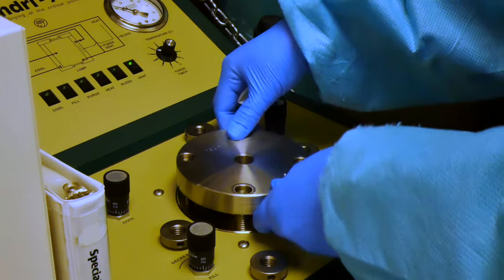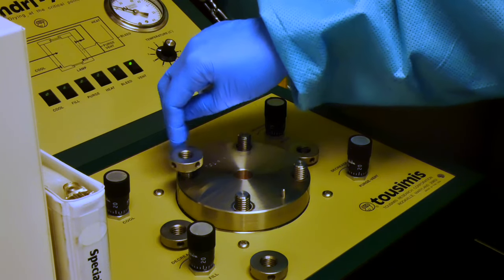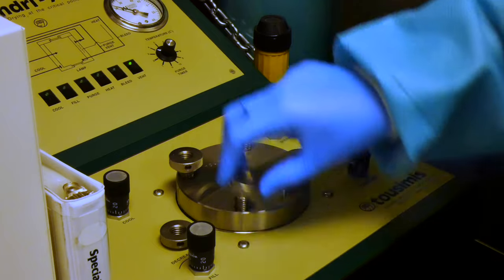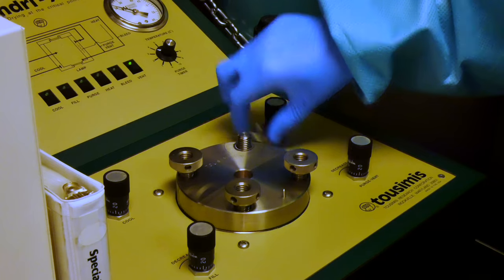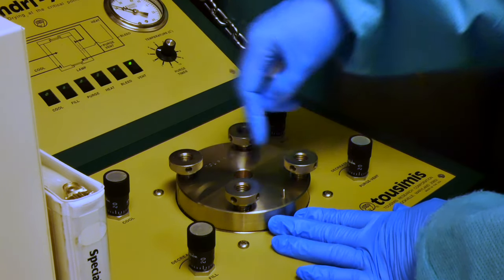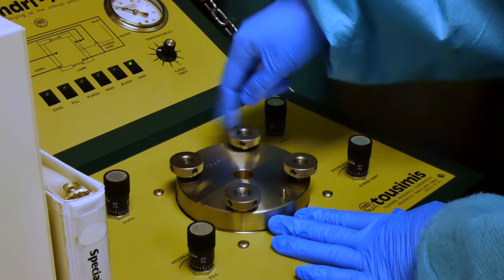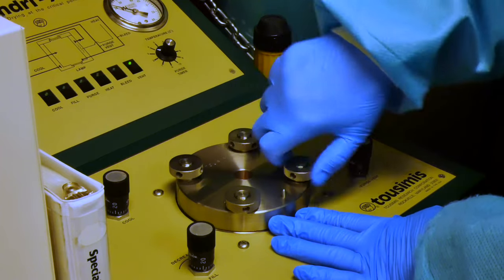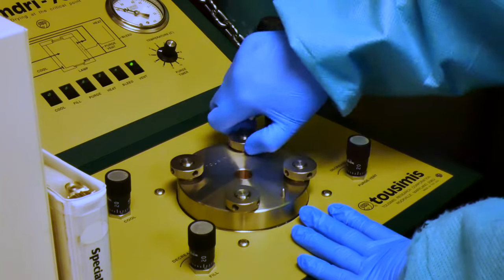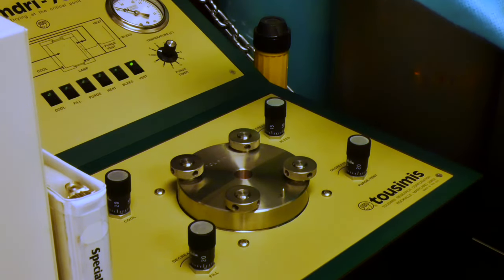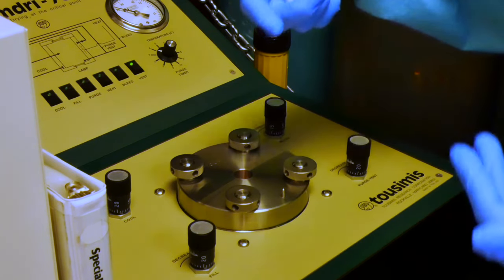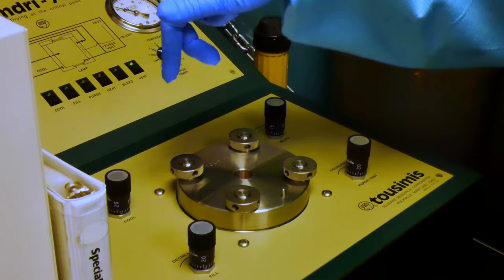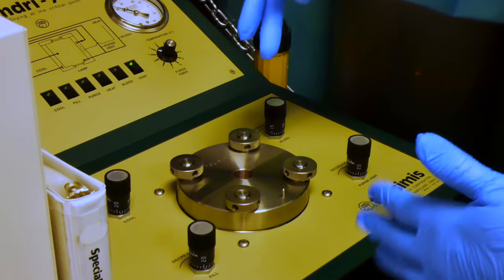And we'll secure the lid. And we'll use a diagonal method to tighten the bolts. As you're tightening down, right now it feels like nothing is continuing to move too much. And you do when you're removing the bolts, it's also important to do it in a diagonal fashion. If you open one too much, it'll cause the rest of it to kind of make a seal and you won't be able to open it up.